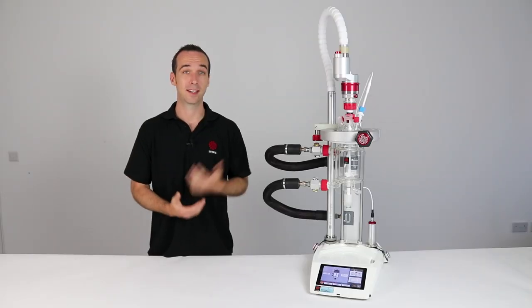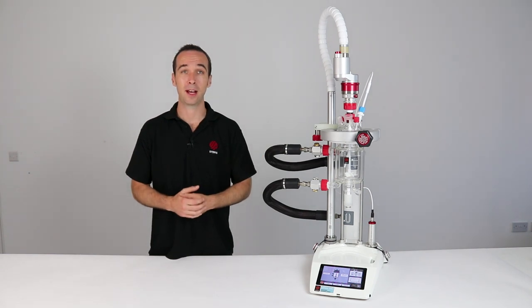To demonstrate just how simple it is to set up an Atlas HD system I'm now going to disassemble and reassemble this using nothing but my bare hands.